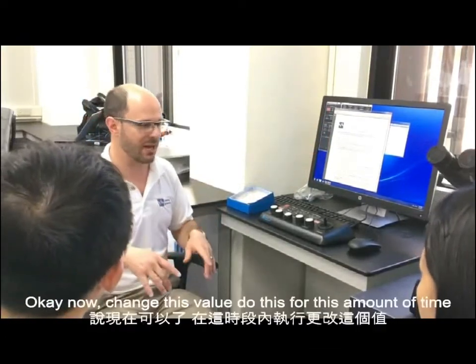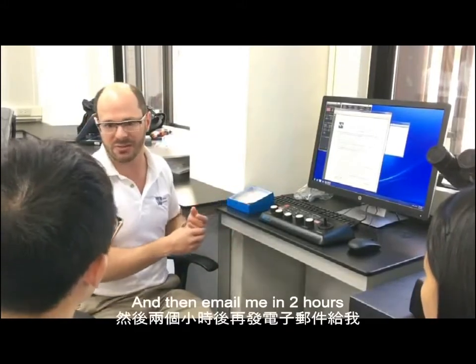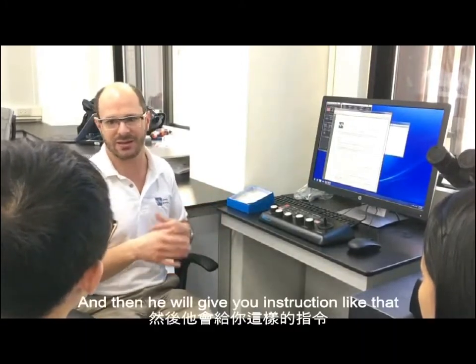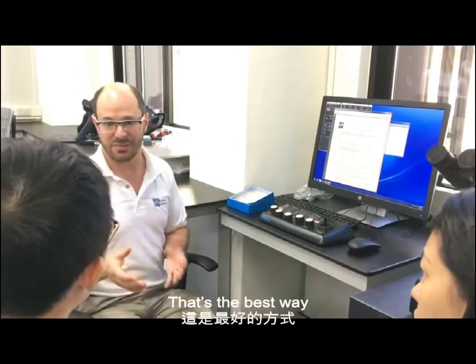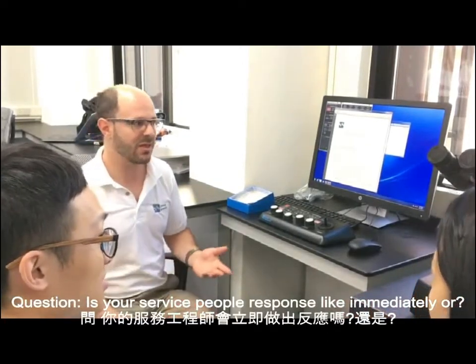He'll send you an email: okay, now change this value, do this for this amount of time, and then email me in 2 hours. And then you'll give him some information. He'll say, okay, looks good, change this, and email me in 2 hours. And then he'll give you instructions like that. That's the best way. Is your service people responsive, like immediately?